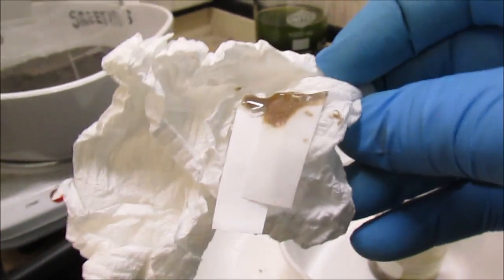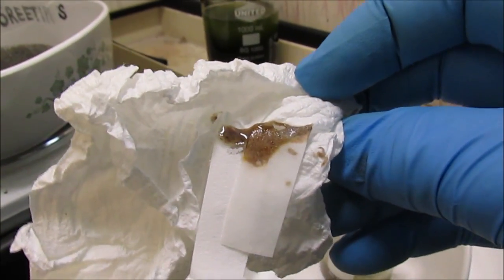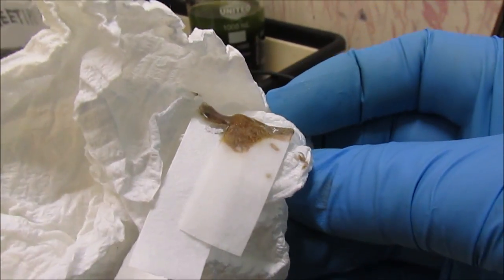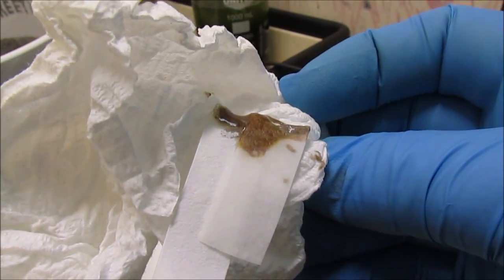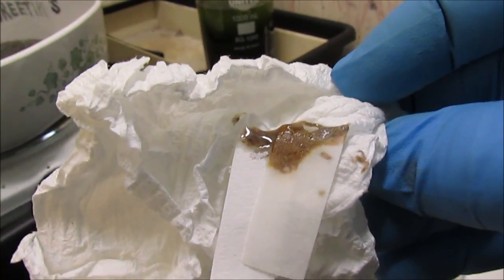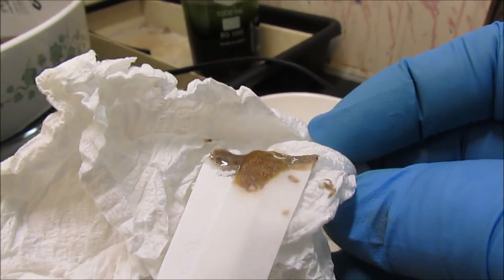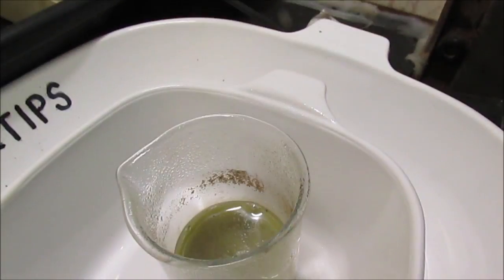I put some stannous on that paper and I think I see a little bit of orange going on in there, so it might be putting something in solution here, some metals in solution. And once I get that, I don't know how to get it out of there.